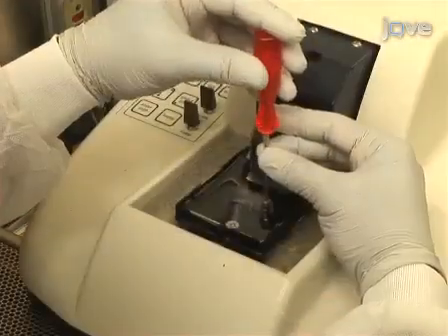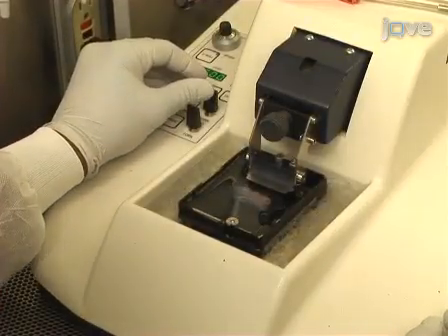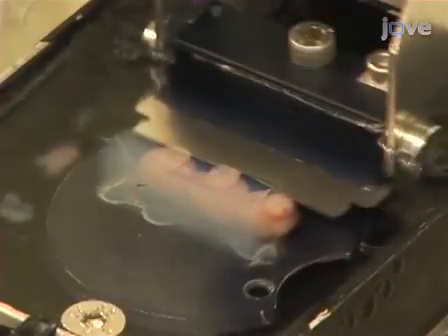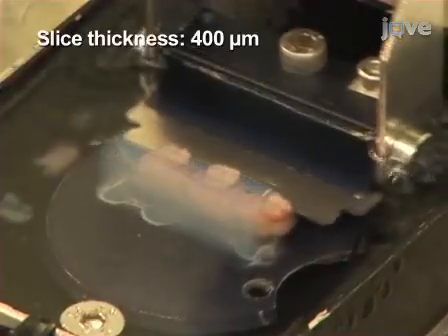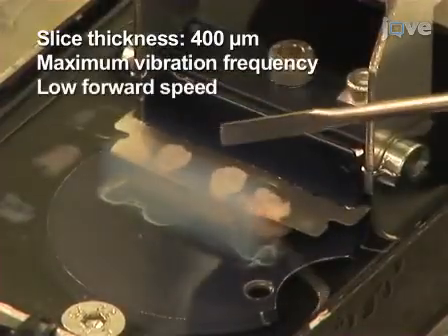Next, carefully submerge and secure the mounting disc with the mounted brains in a vibratome tray filled with chilled gey's solution. Then, with a carefully cleaned razor blade, cut 400 micrometer thick coronal sections of the midbrain at the highest vibration frequency and relatively low forward speed.